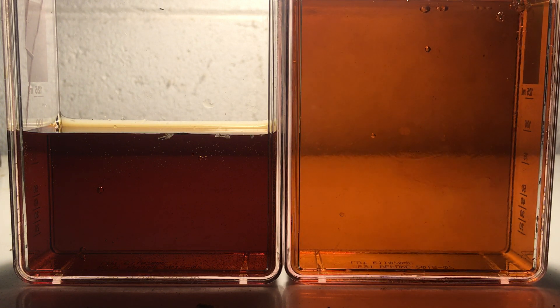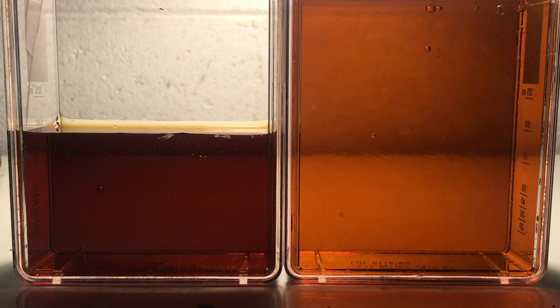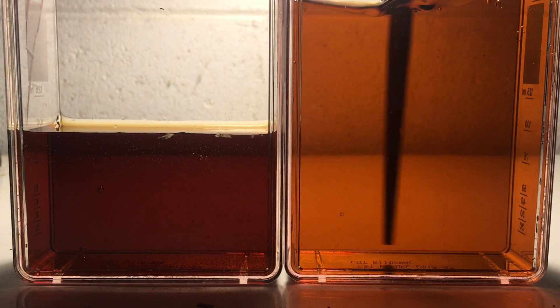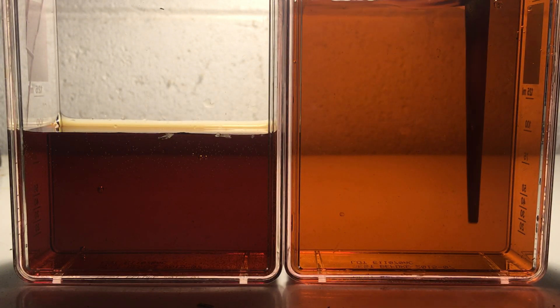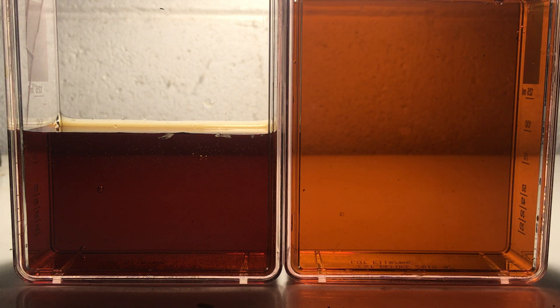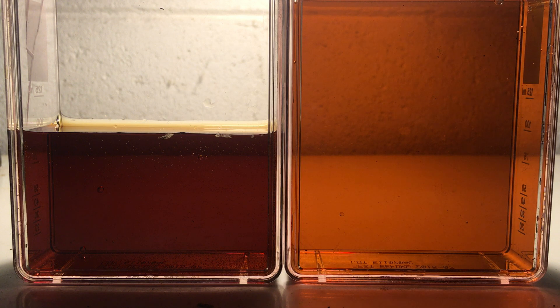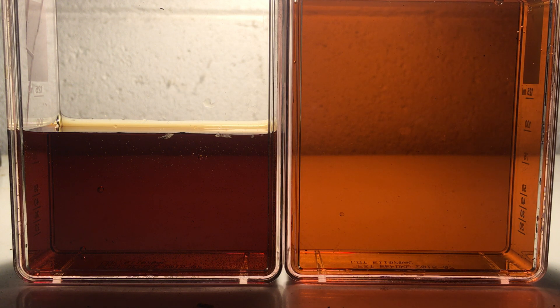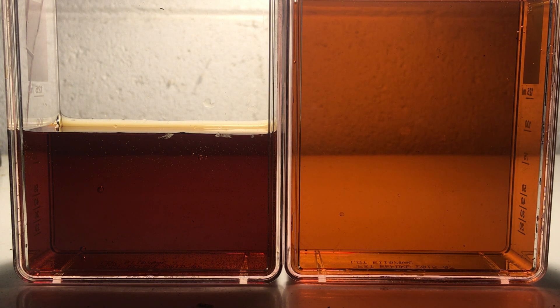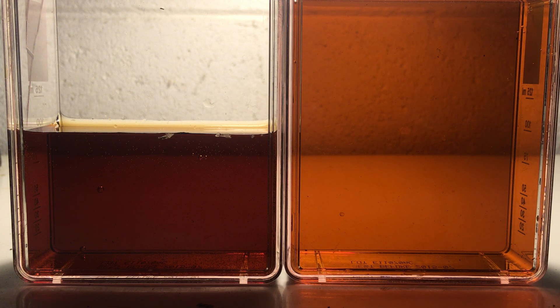And we have that here. I'm going to stir that up and make sure it's all mixed. I've cut the concentration by a factor of two by increasing its volume by a factor of two. And when I do that, you can see that the light absorbance is cut by a factor of two.